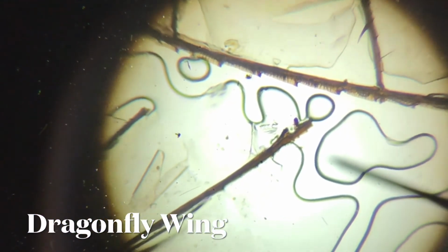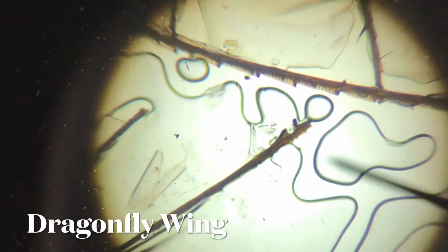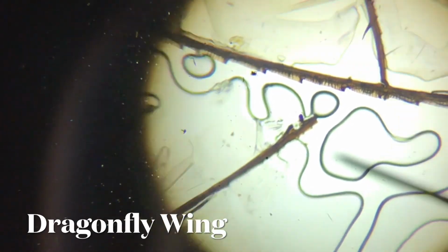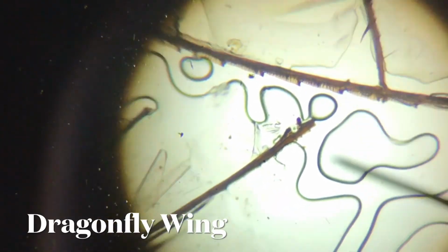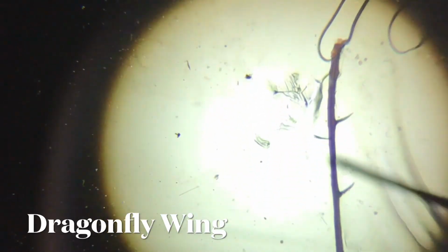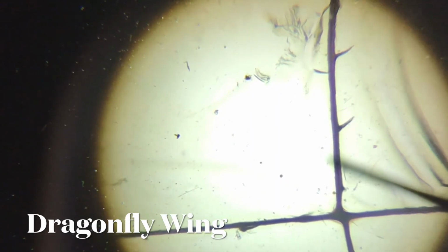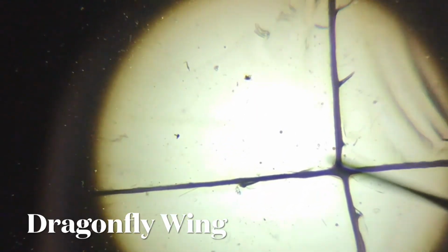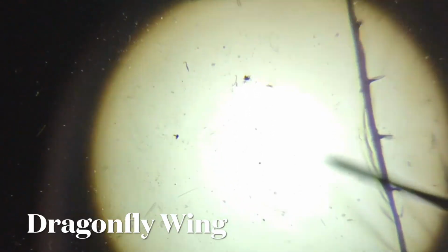The next part of an insect that we're going to see here is a dragonfly's wing. For a dragonfly's wing, you are able to see that there are many parts that are clear, and there are also many parts that are jointed. If you zoom in, you can see the spikes, or the hard outer body covering of hairs, even on the wings itself.